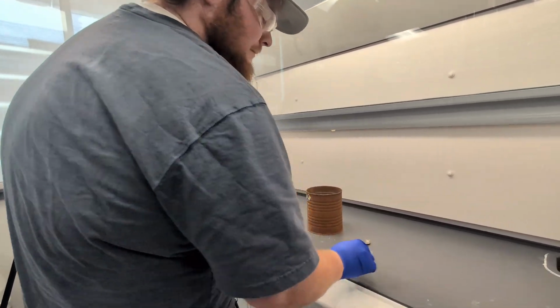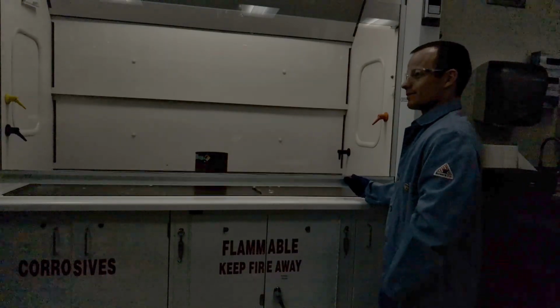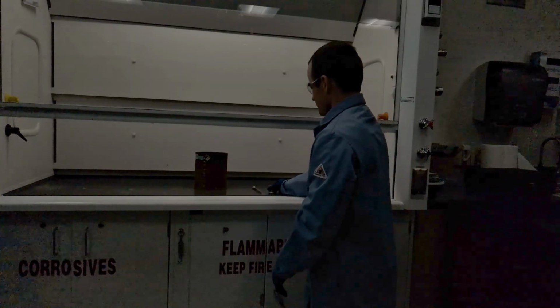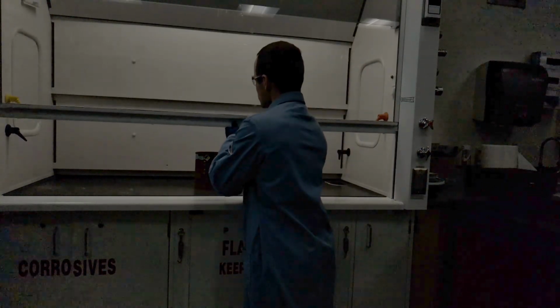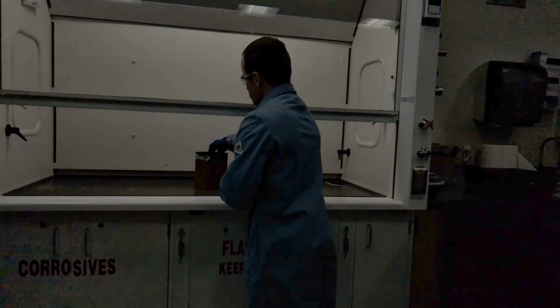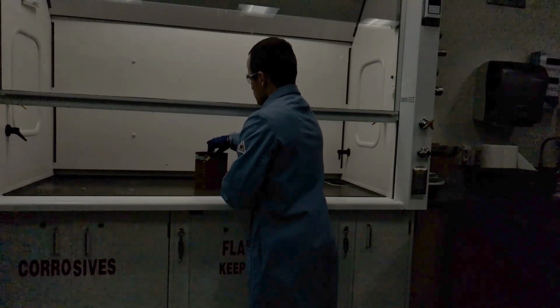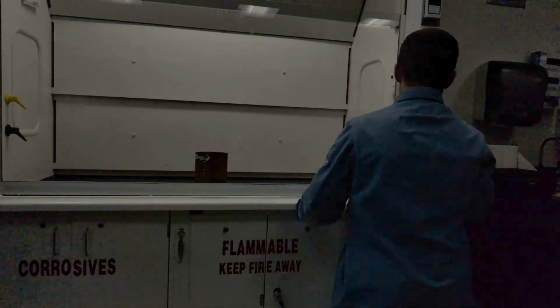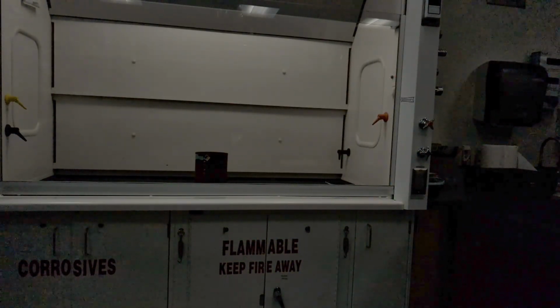Okay, I'll just quick fire. Okay. Go ahead when you're ready. I turned down the exposure for my phone because the reaction is super bright. So it looks a little dark right now, but you'll see in a second why I turned it down. It should start within 15 to 60 seconds.